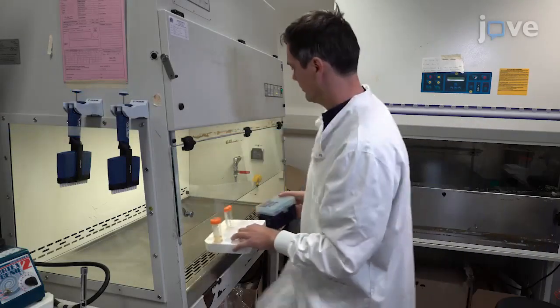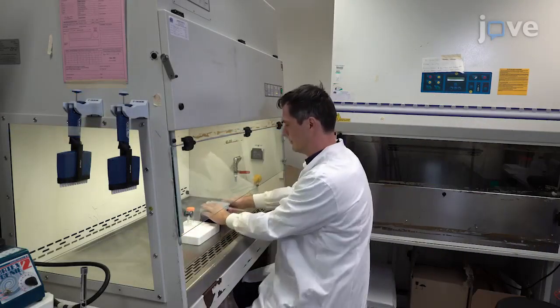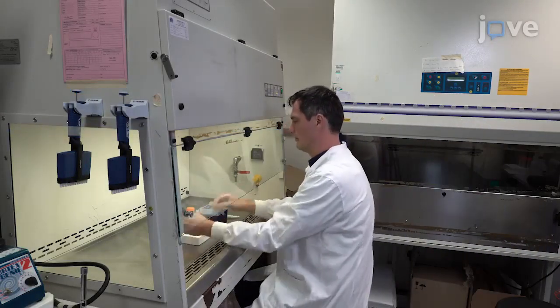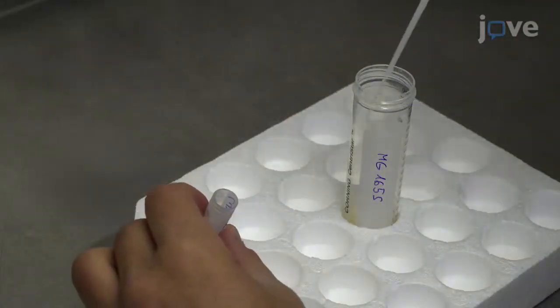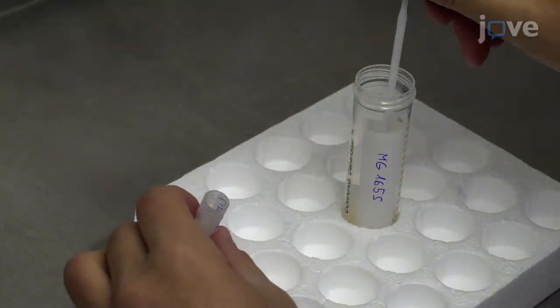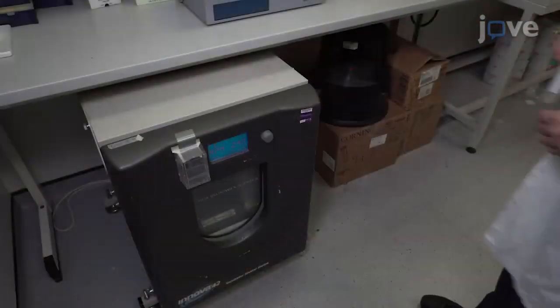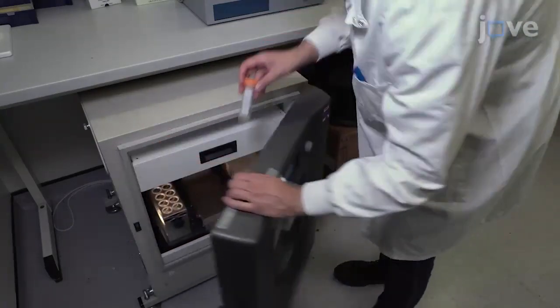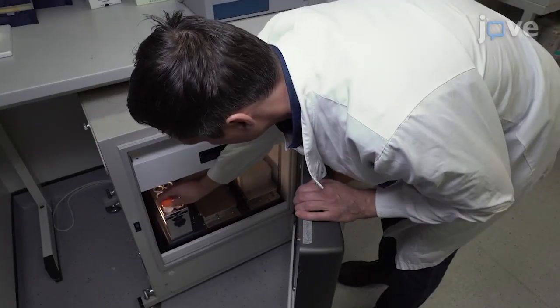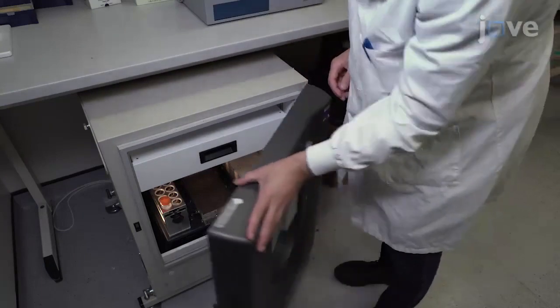To begin this procedure, inoculate three milliliters of liquid lysogeny broth with a scrape of ice from the E. coli K12 glycerol stock. Shake the LB culture at 120 RPM and at 37 degrees Celsius for approximately seven hours.